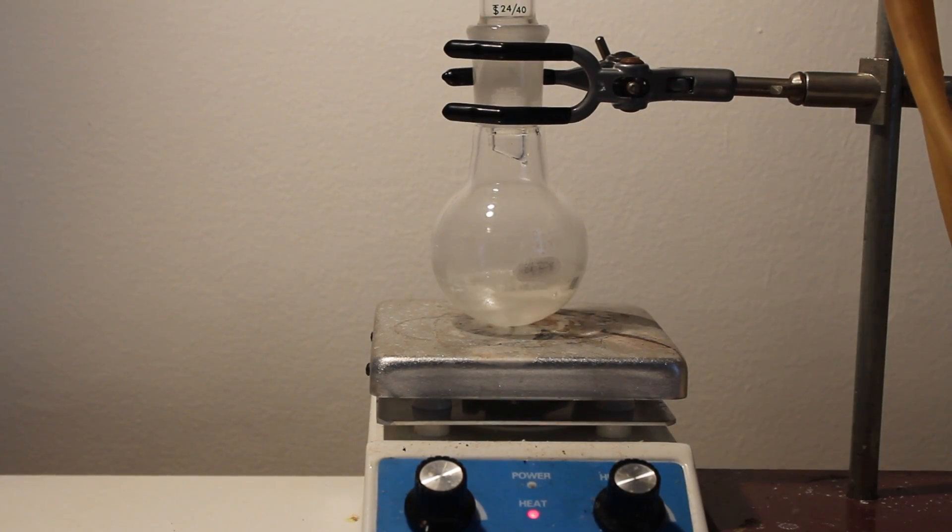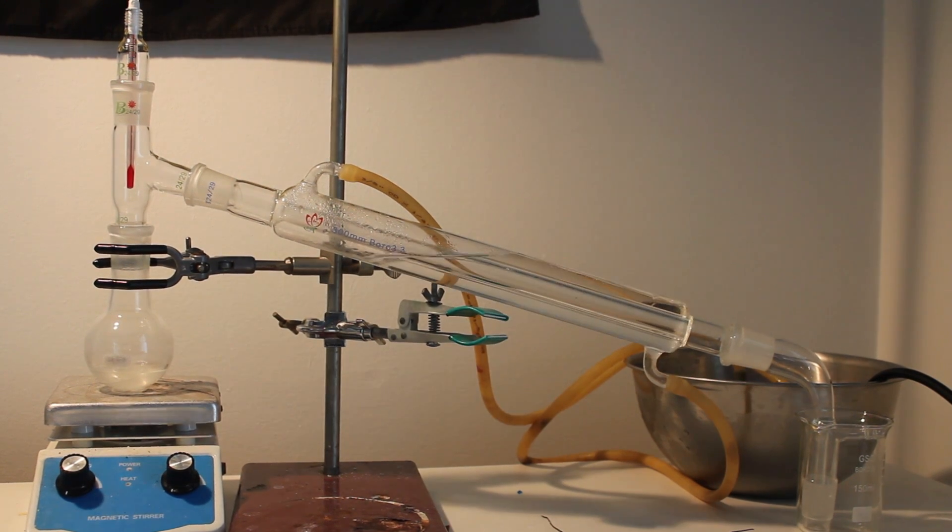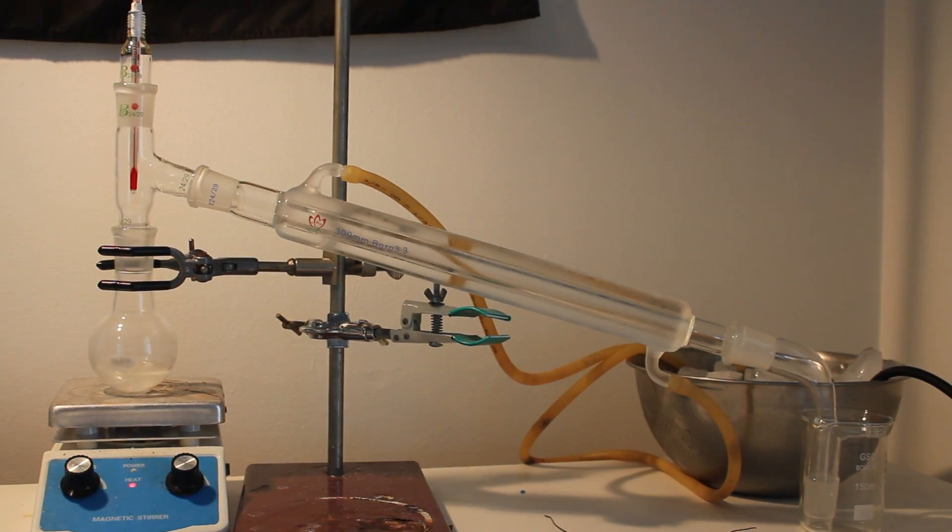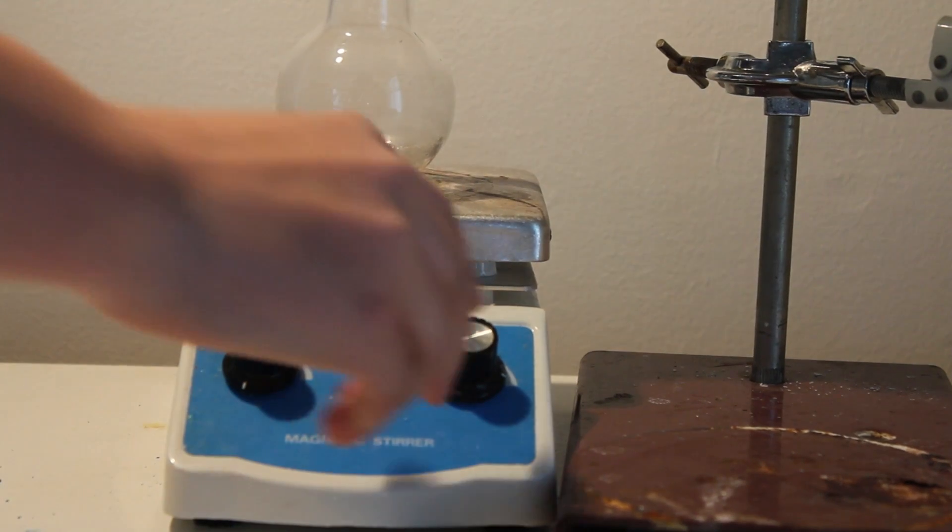One hour later, turn off the heat. Set up a distillation apparatus and distill everything off until you reach 120 degrees Celsius. Then turn off the heat.